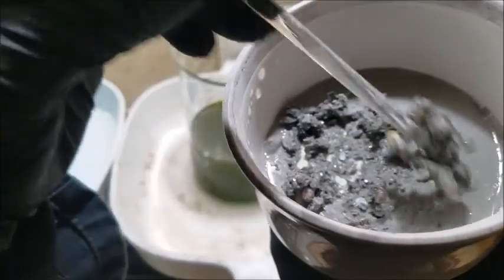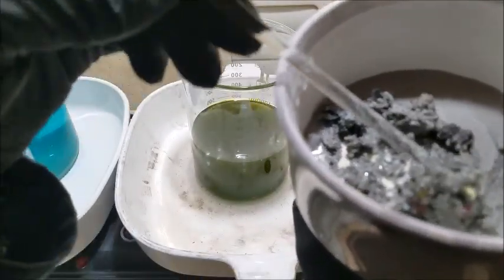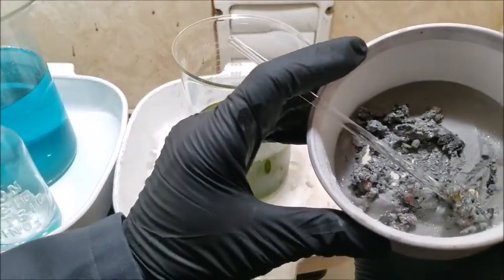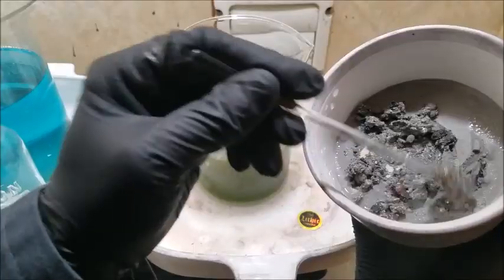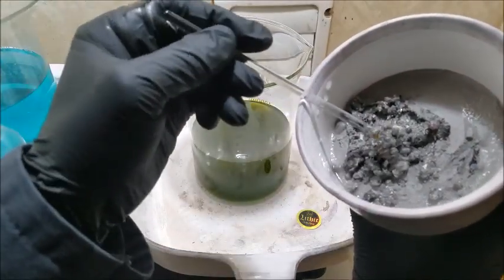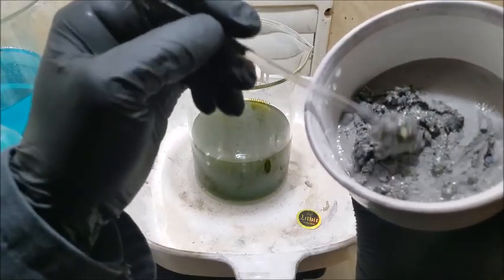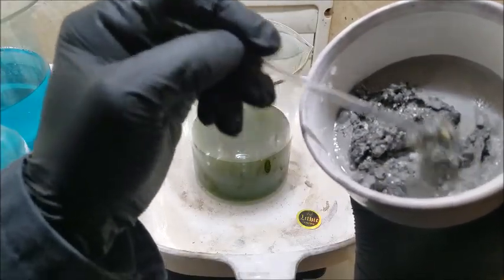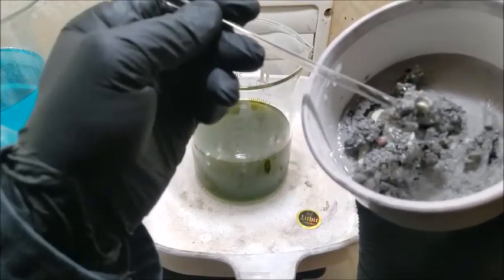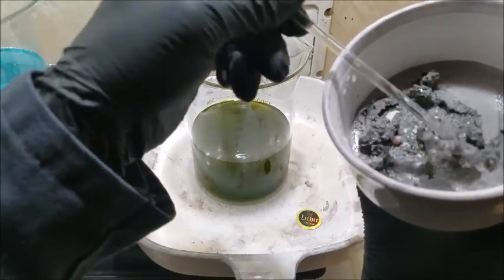But if there was anything worth saving, I would have removed it ahead of time. So, sorry, that wasn't really in focus, was it? Sorry about that. Well, here's what we got. Various stones and clasps and springs and pulp and just a bunch of junk.